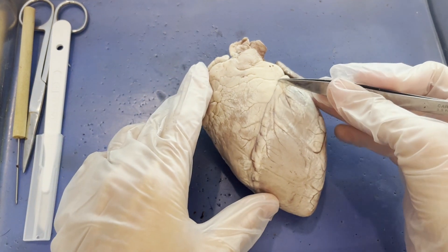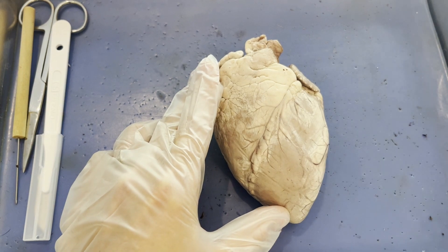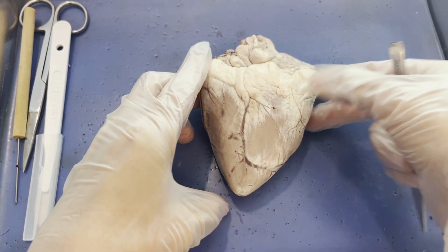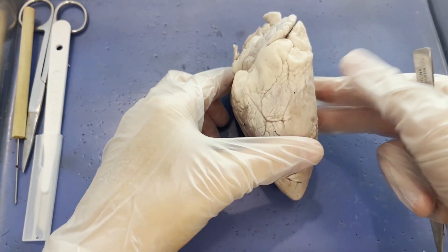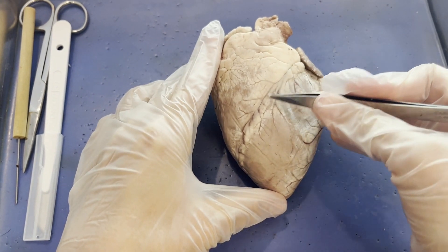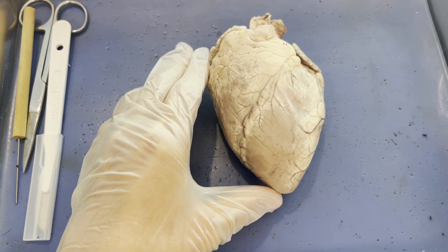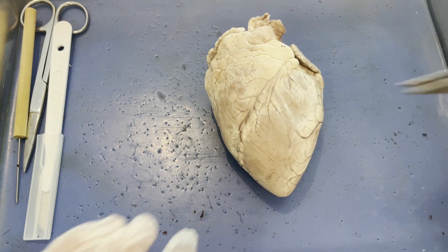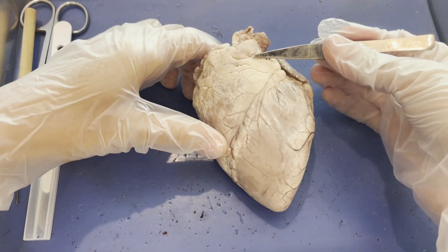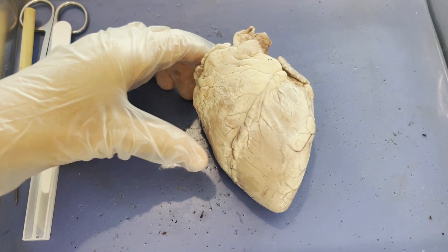Let's quickly review. We see coronary arteries crossing the heart that supply blood to the heart itself. Cardiac muscle tissue makes up the majority of the heart, and adipose or fat tissue covers it as well. The anterior portion of the heart rises higher, has coronary arteries crossing left to right, and the apex points left. The posterior side drops lower and the apex goes the wrong way. The upper base holds all the blood vessels, and down here is the apex or inferior portion. For dissection, keep the superior end away from you, apex toward your chest, and anterior facing up.